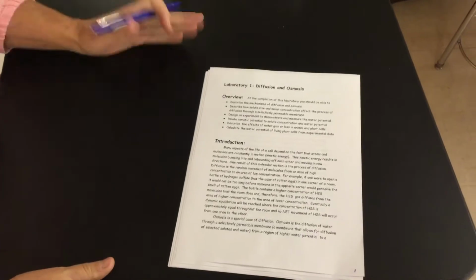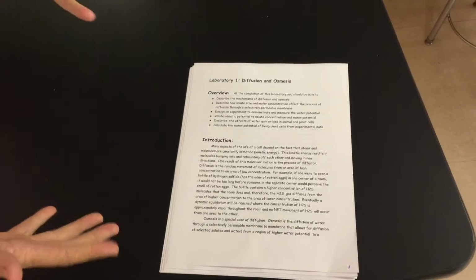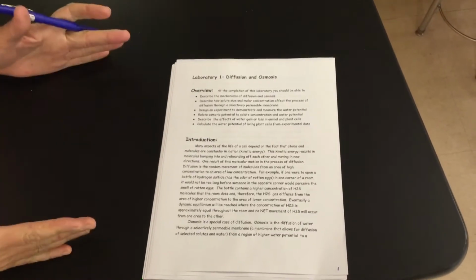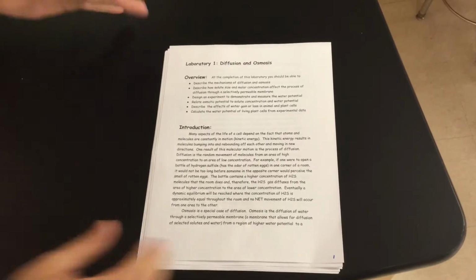All right, so we are now doing the diffusion and osmosis lab. This is going to be a 2-day lab for either the A cohort as well as the B cohort. You guys are going to be letting this sit overnight once we set up our couple parts. The first part's going to be a demo where you guys are looking at stuff qualitatively. The next part is more quantitative, so you guys will be collecting more numbers on that.